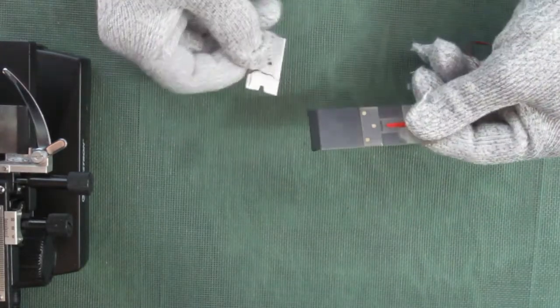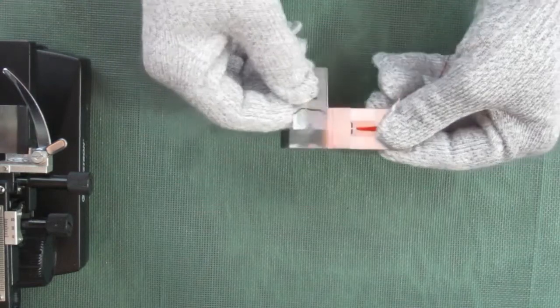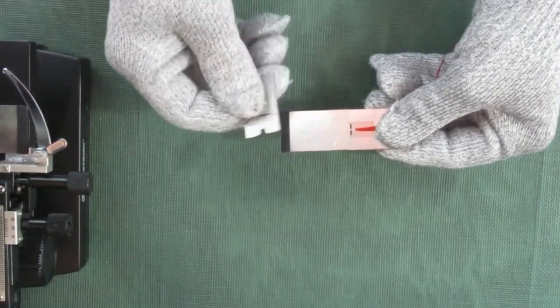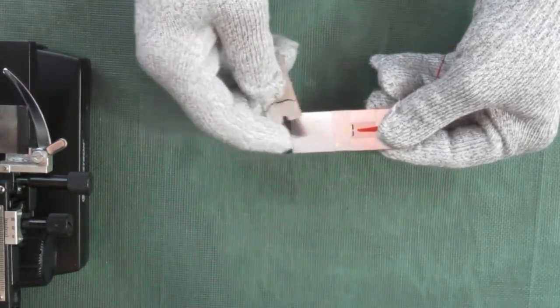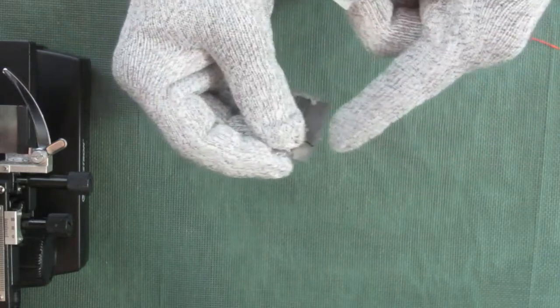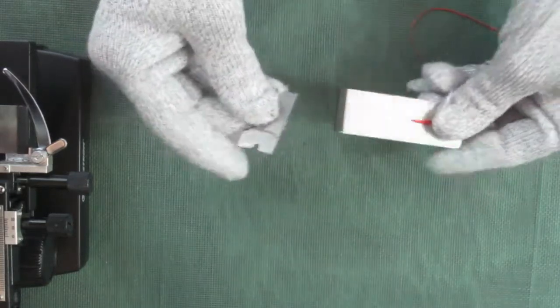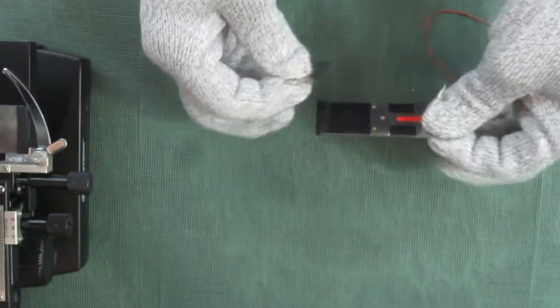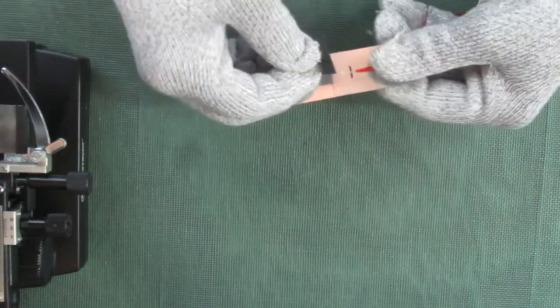So the razor blade should be set at approximately about a 15-degree angle. That's the angle at the very short cutting edge, not this big one, the very short one at the very edge.